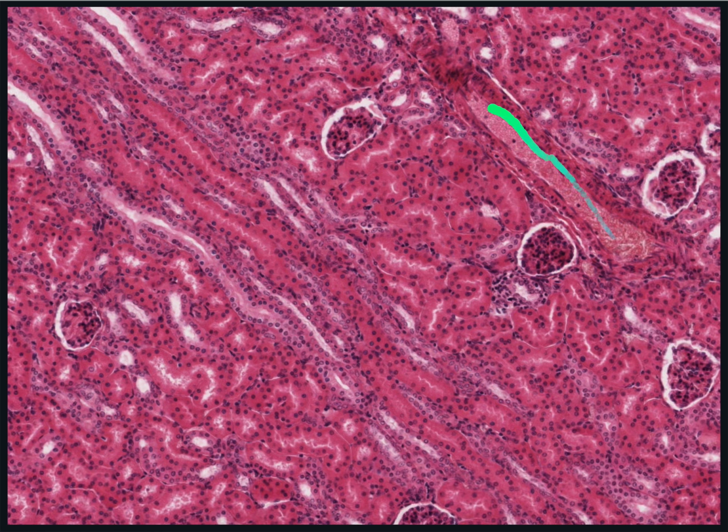So this area, the cortex, across to the medullary rays here, and then across to an area about here, where there would be another interlobular artery, but it's out of the section plane here, would be a lobule. So it isn't as easy to structurally define the components of a kidney lobule compared to the lobule of an exocrine gland, as there are not prominent connective tissue elements which border and clearly demarcate kidney lobules.